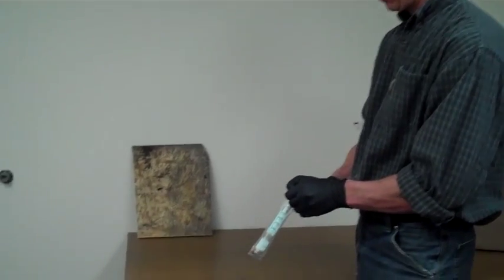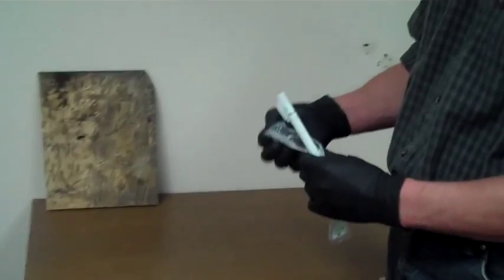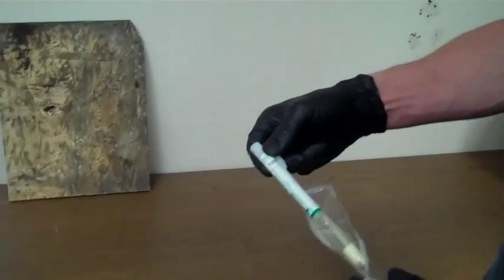The first type of surface sample we will be collecting is a swab sample. Swab samples are used on porous or irregular surfaces.